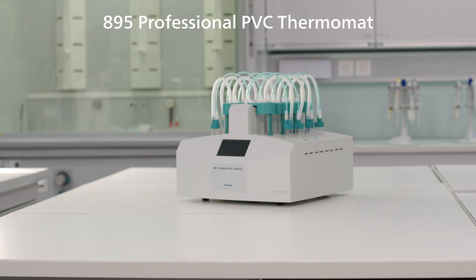For the thermal stability measurements of PVC use the short reaction vessel, the air tube for PVC measurements, the silicon tubing and glass or polystyrene beakers.